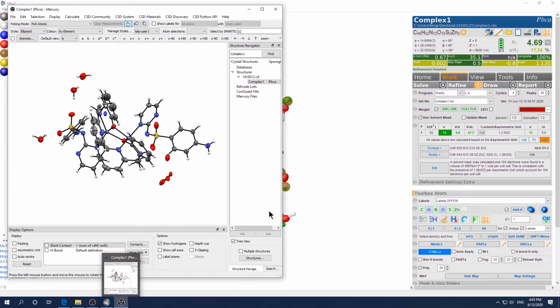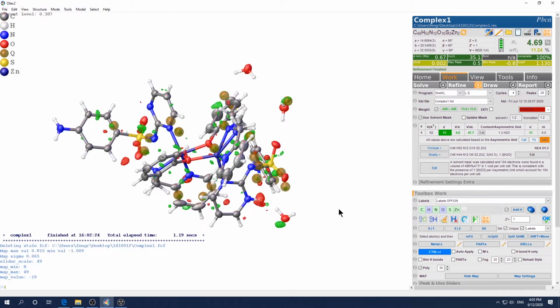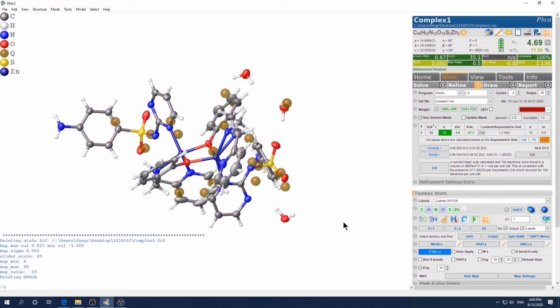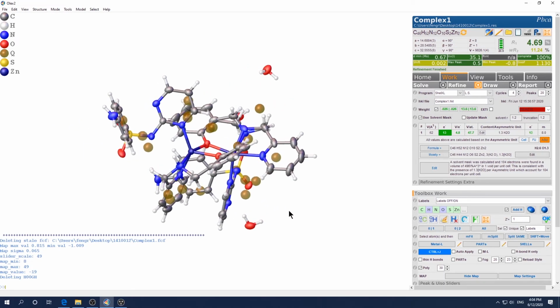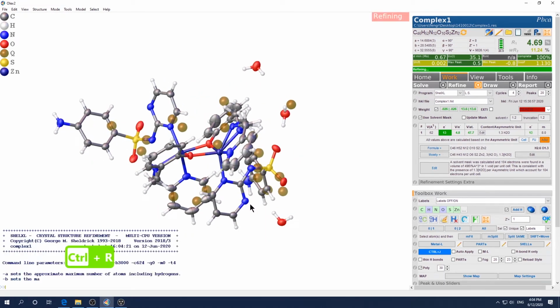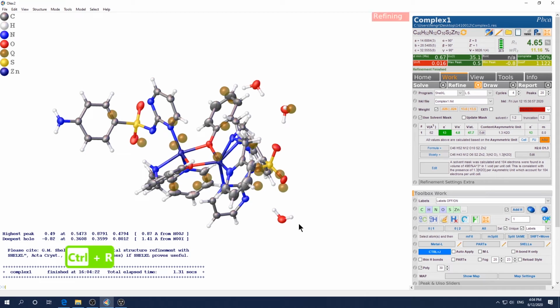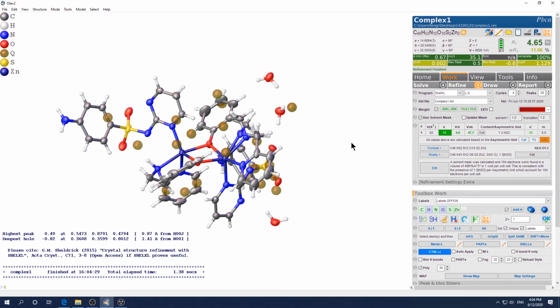So I have to stress that this sample is not mine, so I don't know the chemistry formula or the expected structure. But in real life, when you have a sample, you know pretty well what you're looking for. So probably in the very beginning, you will know, oh, I do not have a proton here, so I should delete this proton in the very beginning. So this kind of mistake will not happen in real life. You will know in the beginning you should not have a proton there. So this is something you don't need to worry about. Okay, let's see what else.